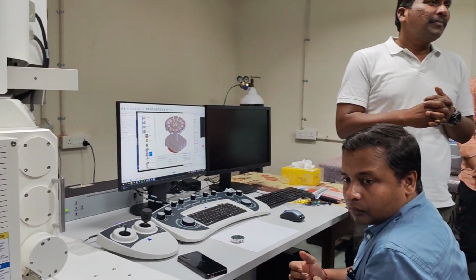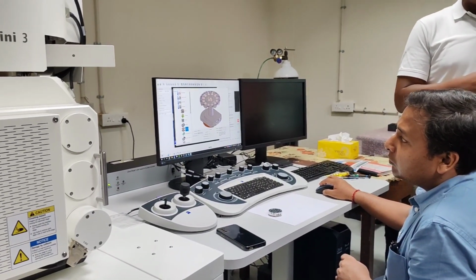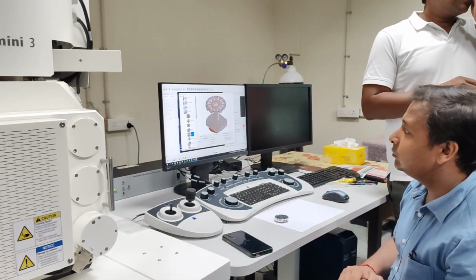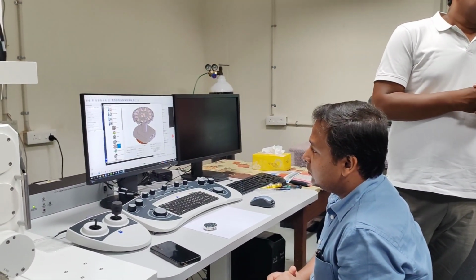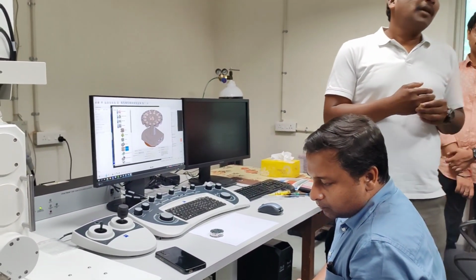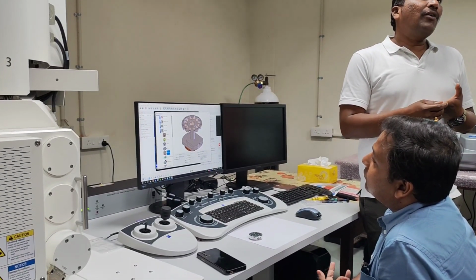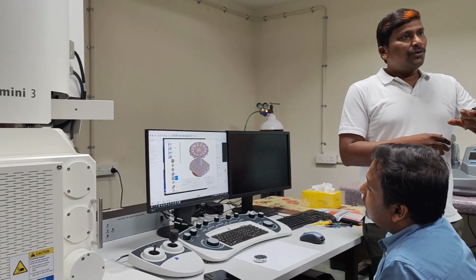So can we provide substrates as well? You mean to say the sample holder? No, sir. If I am spreading the sample on any substrate like FTO or ITO, can we? Which sort of thing are you working on? Actually TM-based material. I want a TM-based material, and I need to make a thin film on the substrate to make a device. For this sort of system, if you prepare it on a good conducting material, that is easy. ITO is still okay, but glass is non-conducting, though the coating you do helps.